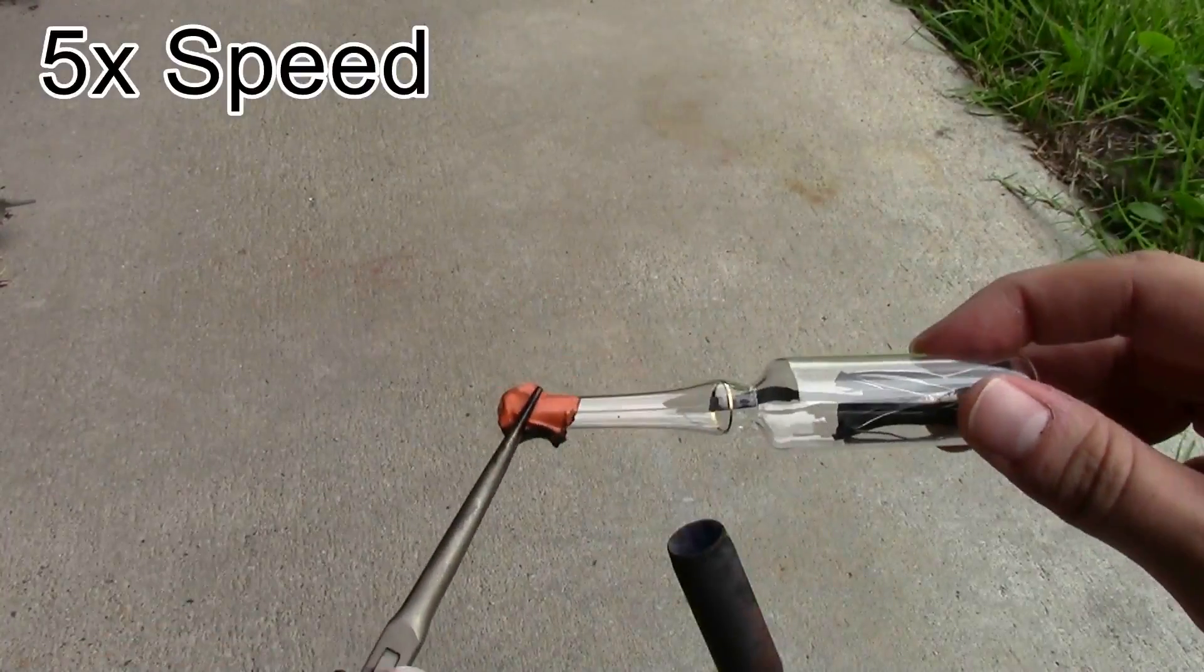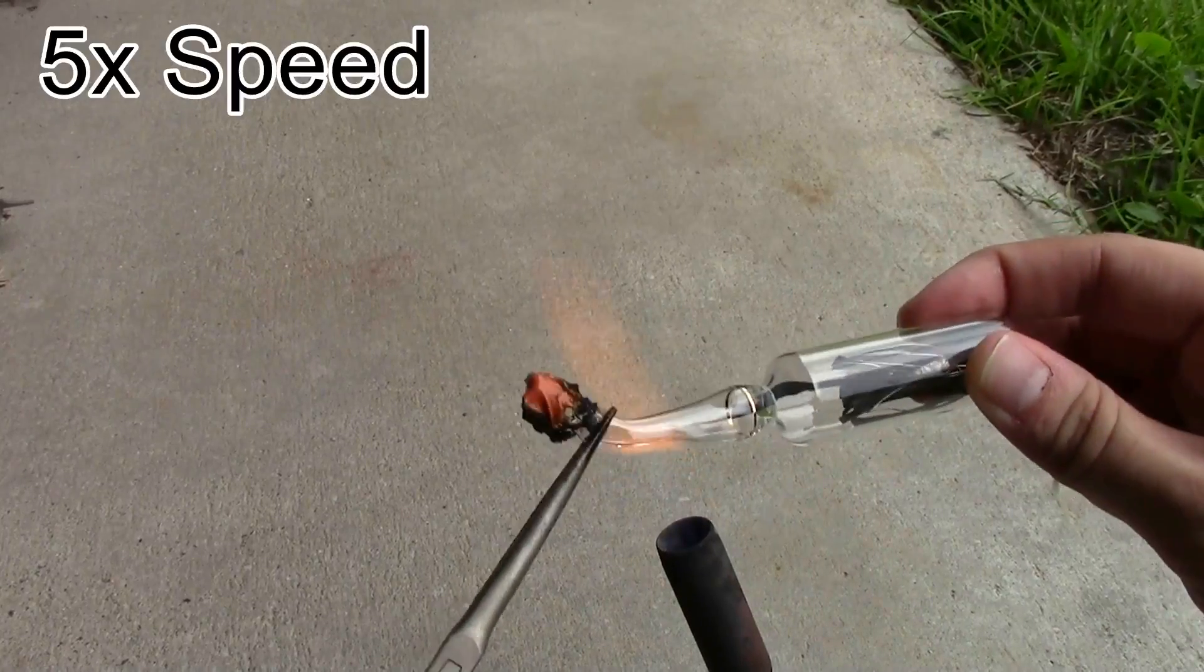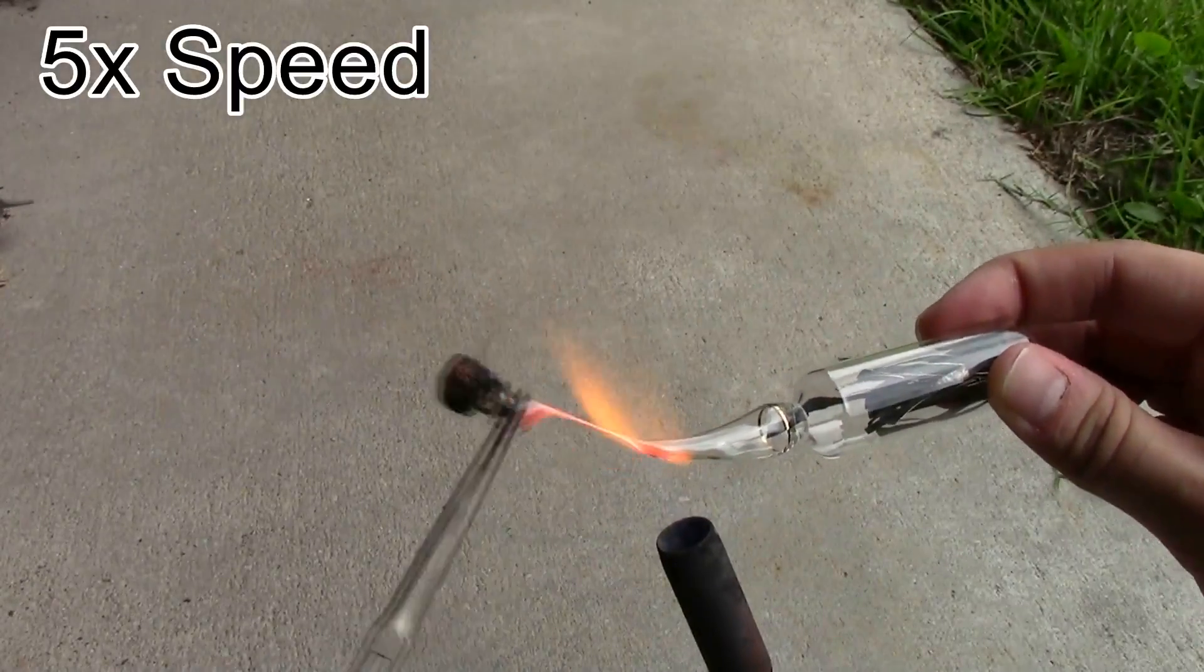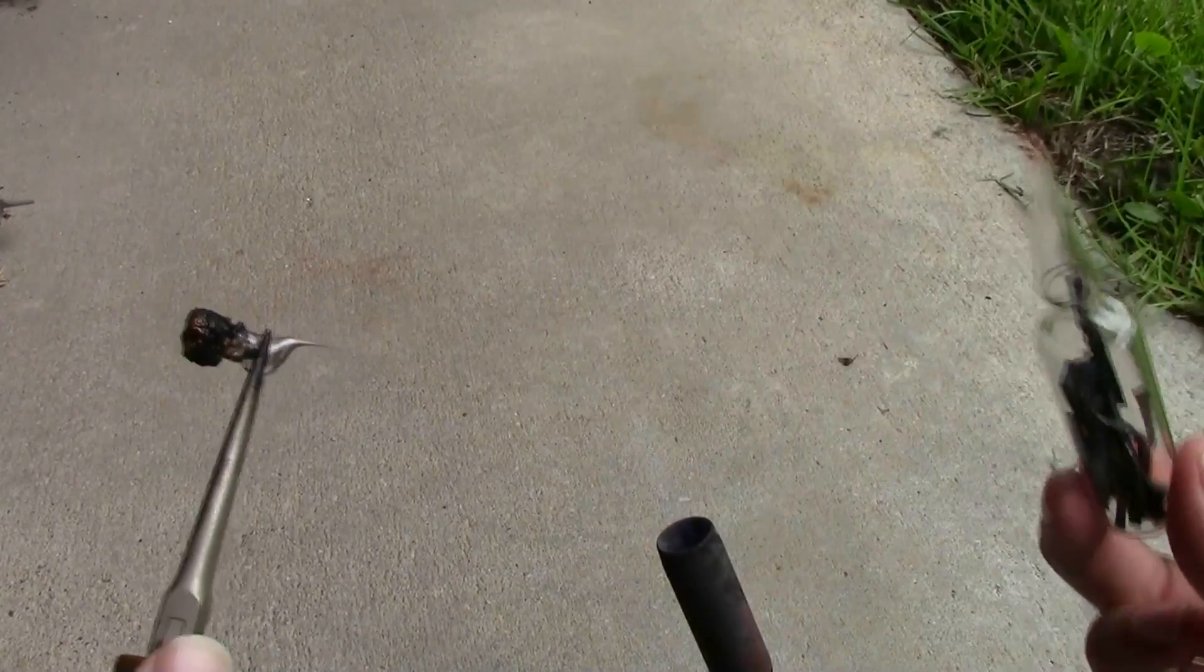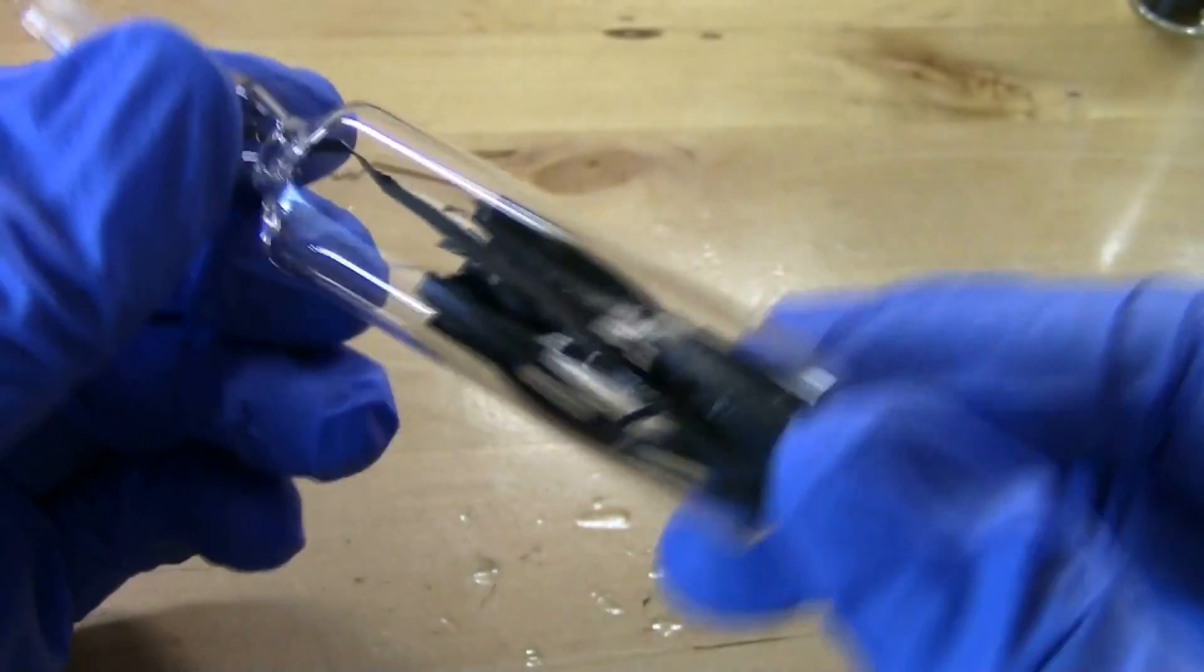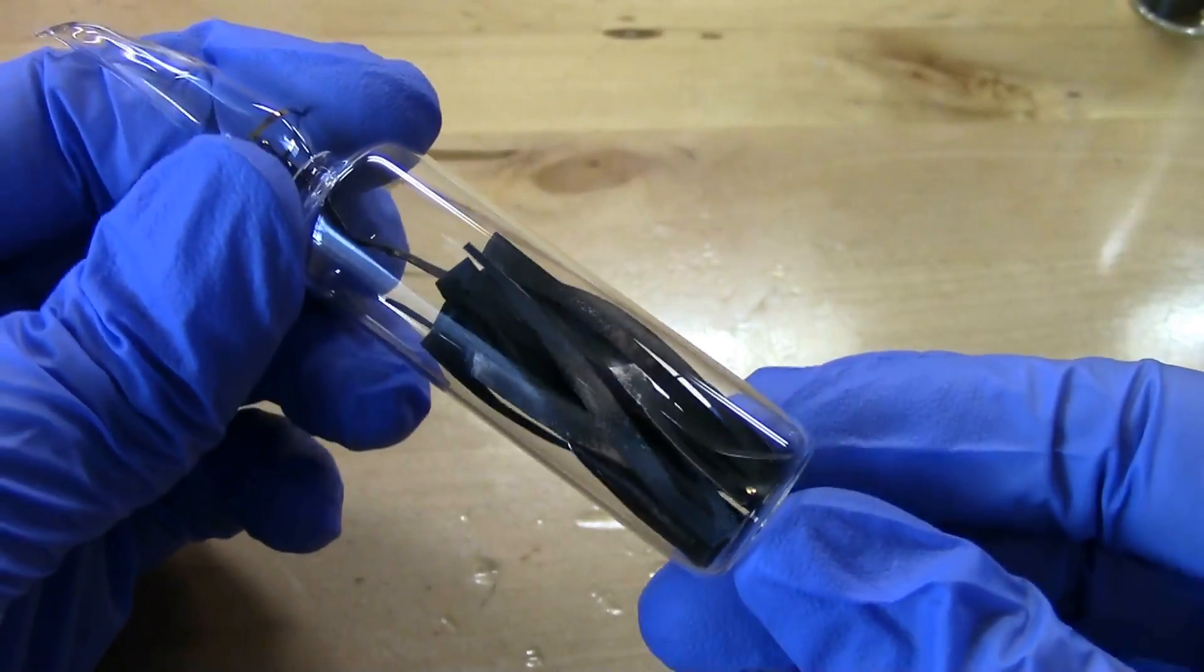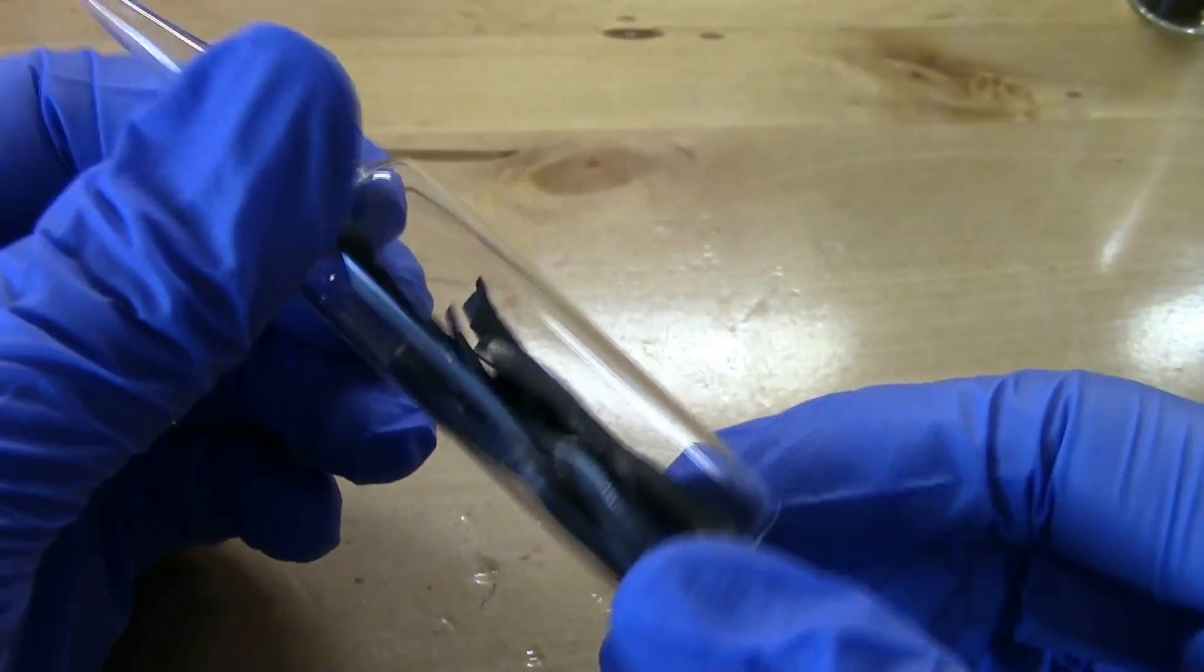Yeah it's a little sloppier than before but hey it still worked. So here's the lithium from that run sealed up permanently in an ampoule. So it's still obviously pretty tarnished but it is much better quality than my original lithium sample so I think I'm making progress.